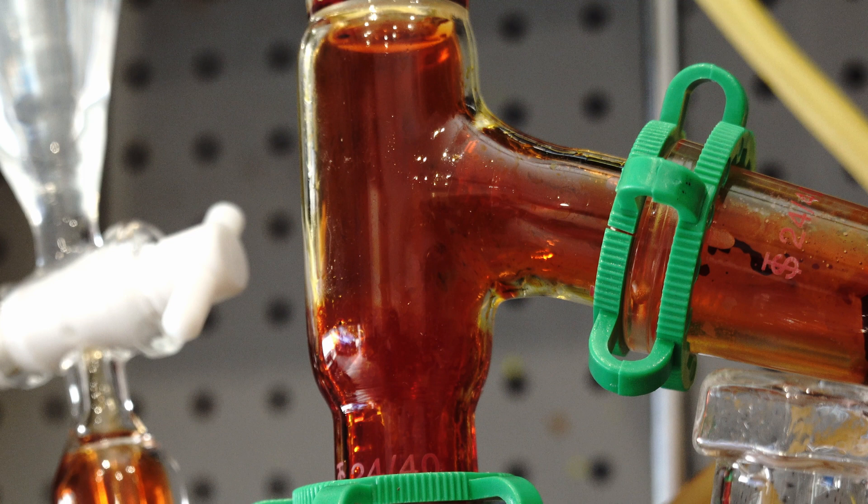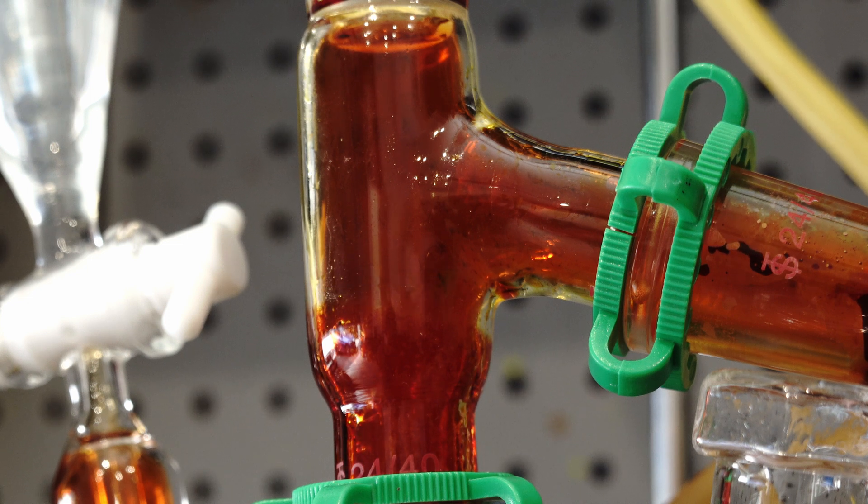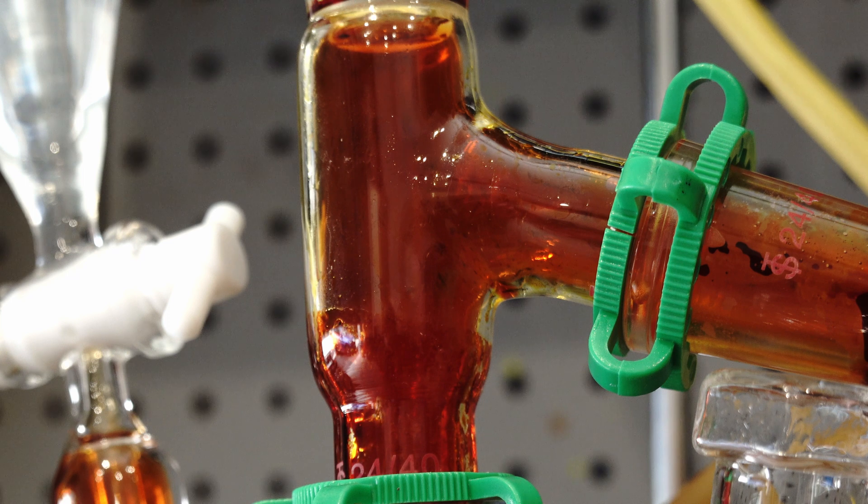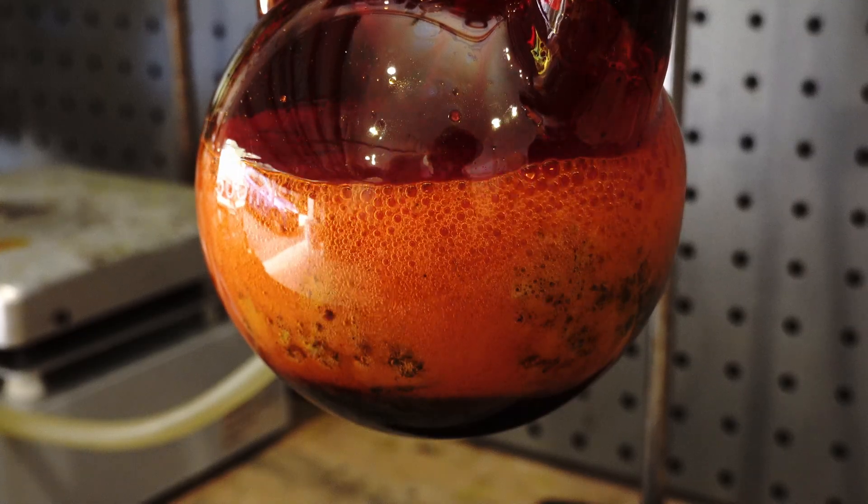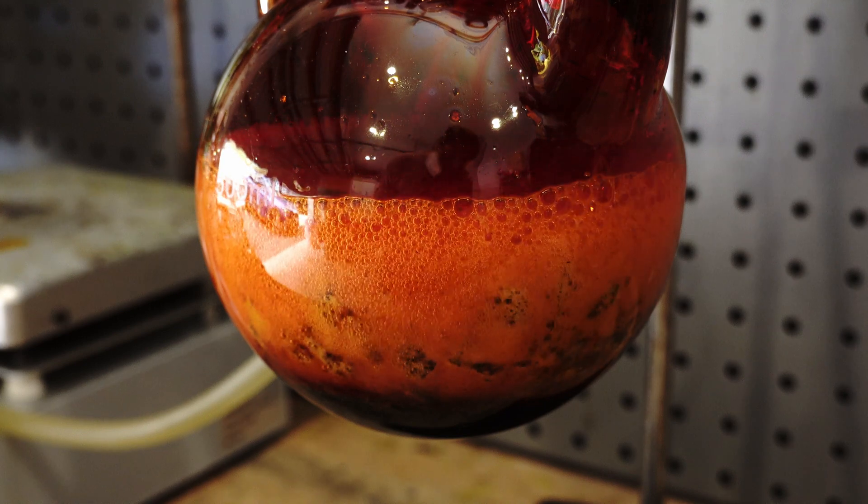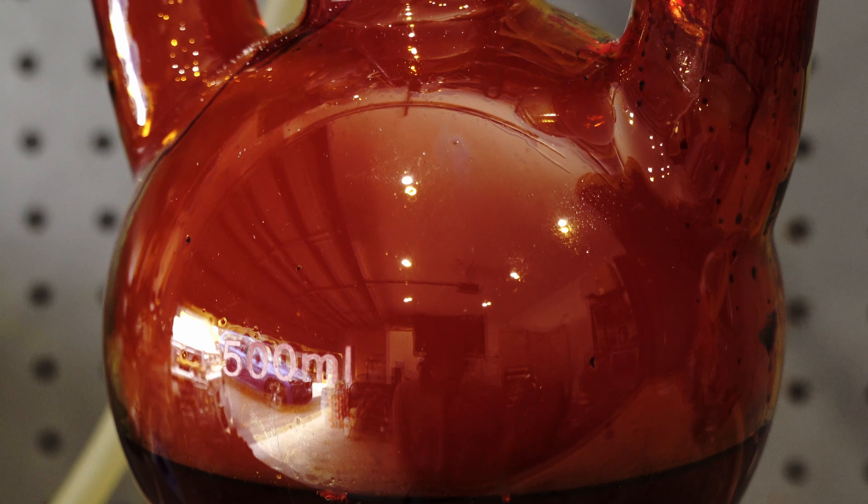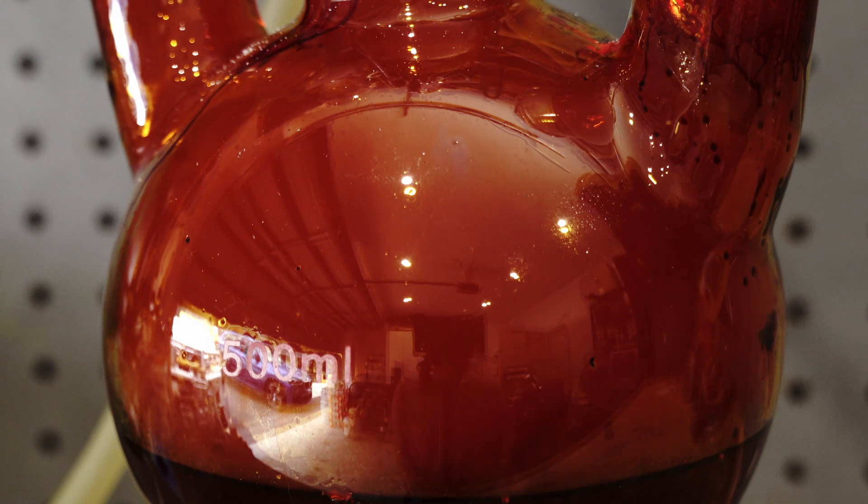Another effect I witnessed was the pulsating Bromine vapours as the sulphuric acid was being added. And here's a shot of the reaction flask as Bromine is being generated. You can see small beads of Bromine condensing on the sides and falling back into solution to be re-evaporated again.